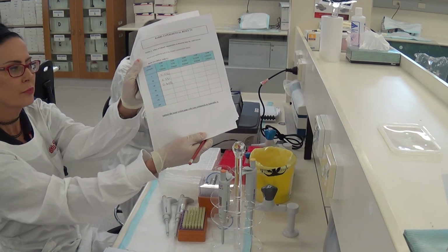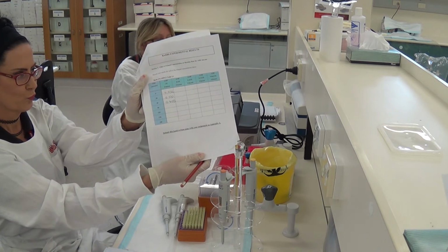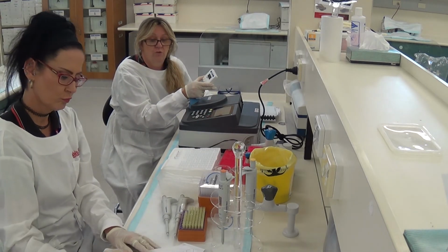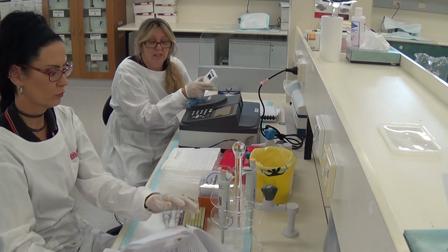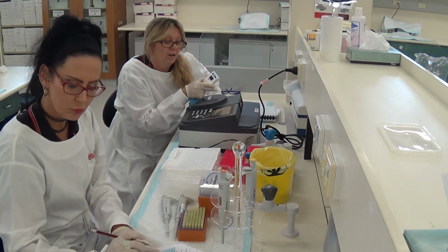I actually want you to submit this table handwritten when we've finished this. I'm going to give you a different set of numbers. This table that we're filling in is just going to be the numbers that I get. I'm going to email you your numbers to go in. 0.533.